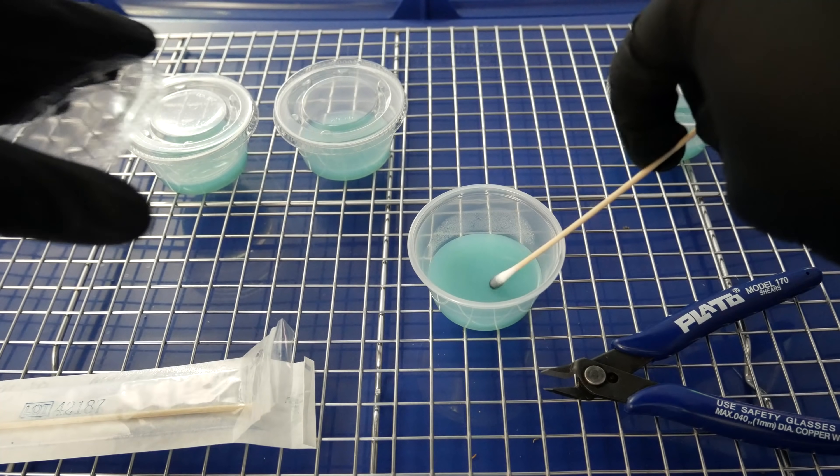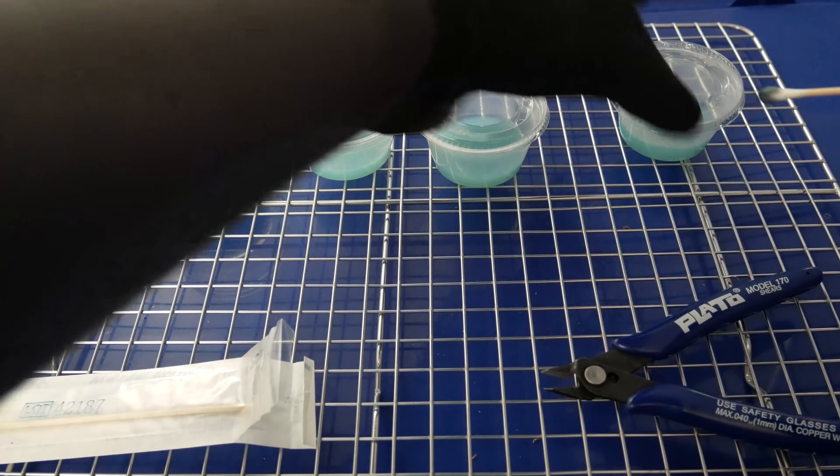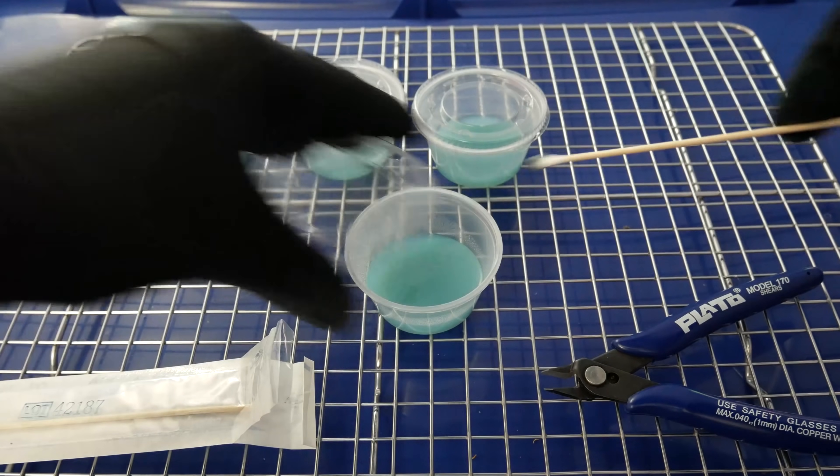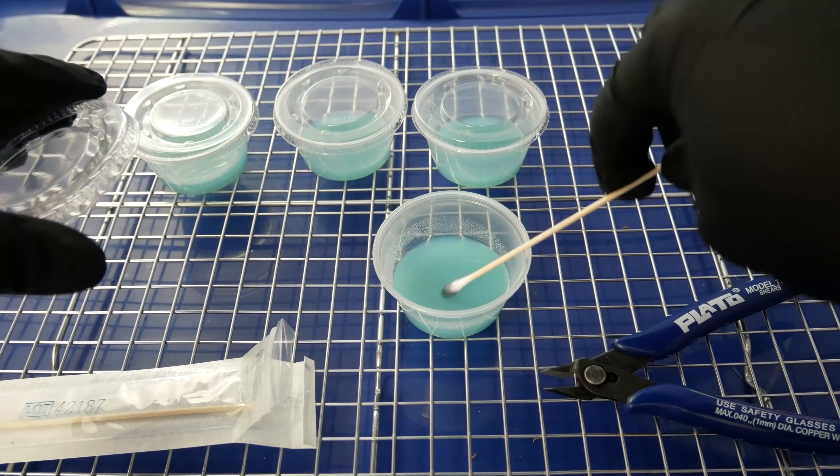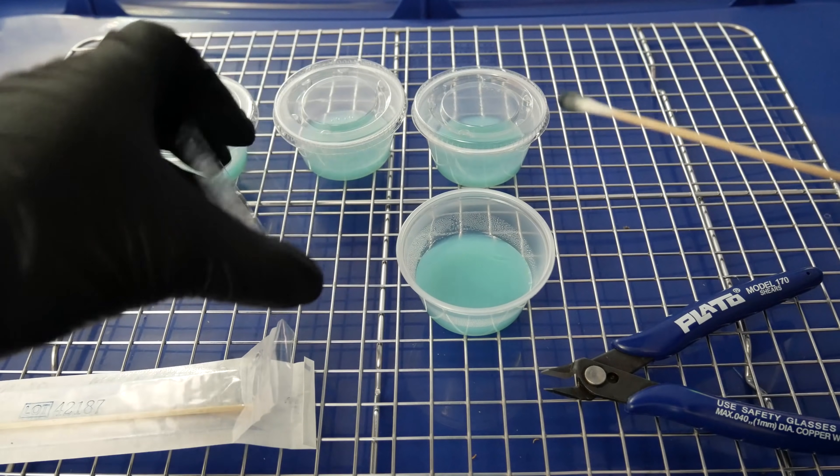Now you're not going to be able to see much happening right here because spores are microscopic, but as long as there are spores on your swab and you're doing it correctly, you will be transferring spores onto the agar.